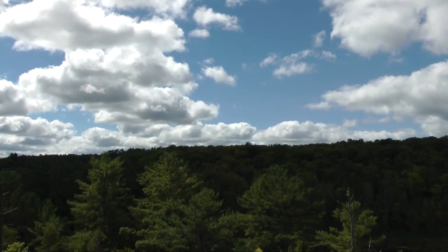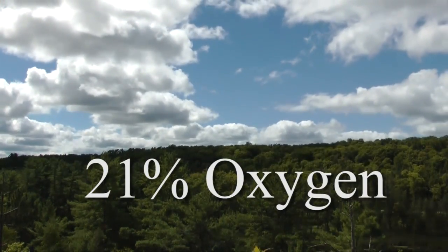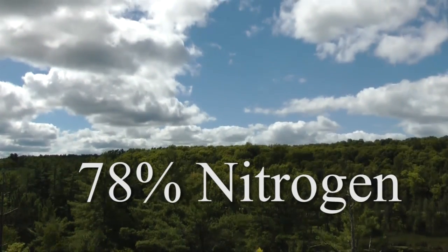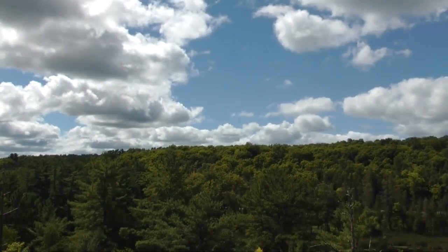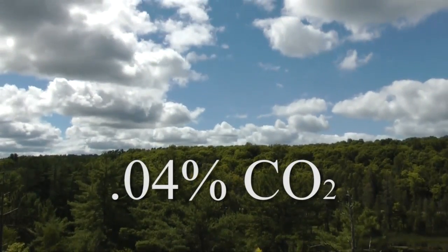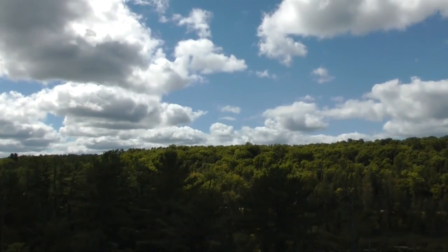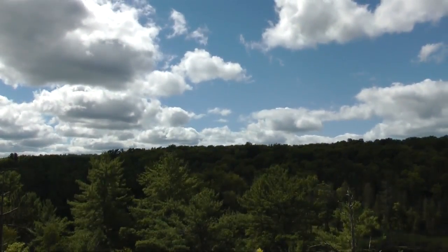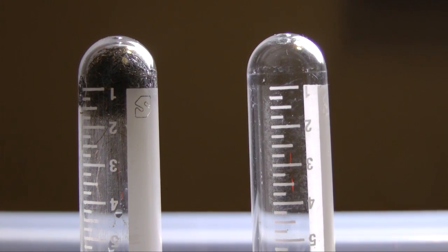Air is complex. Scientists have determined that oxygen makes up approximately 21% of air, nitrogen 78%, and a number of other gases make up the remaining 1%. Carbon dioxide comes in at 0.04%. It is a testament to human ingenuity that we have found ways to determine the components of air. Let's look at a method for determining the percent of oxygen in air.